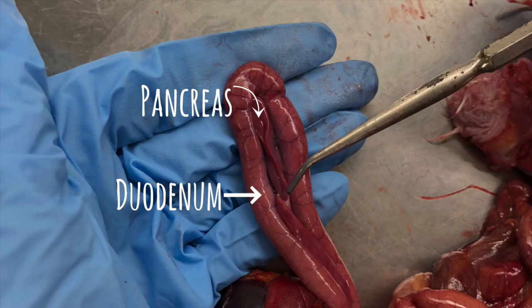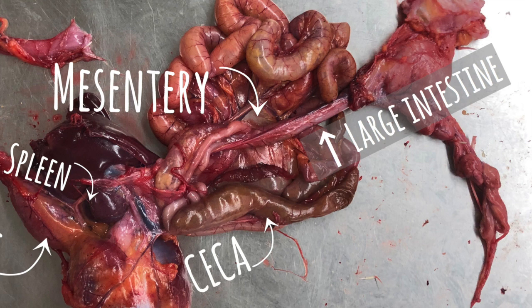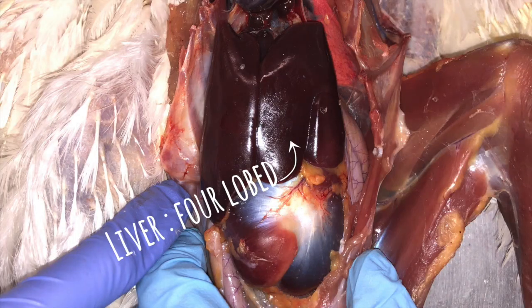The pancreas produces insulin and other important enzymes and hormones that help food digestion. The bile ducts enter the duodenum near the pancreas. The ceca contain bacteria for cellulose digestion. Also, this is the place of water reabsorption. The liver is a large four-lobed gland that filters blood from the digestive tract. It also is a site of detoxification and produces bile.